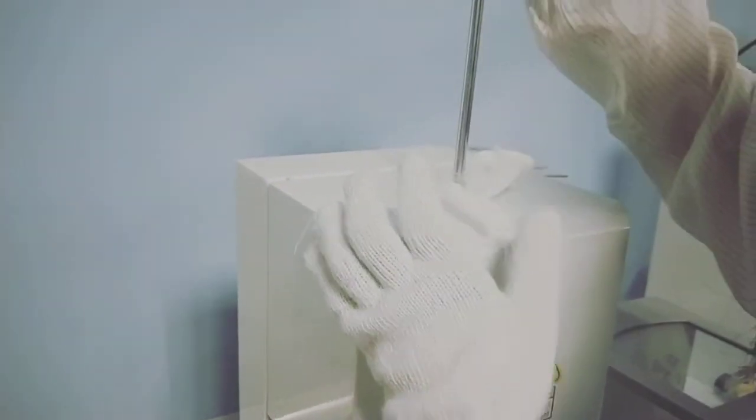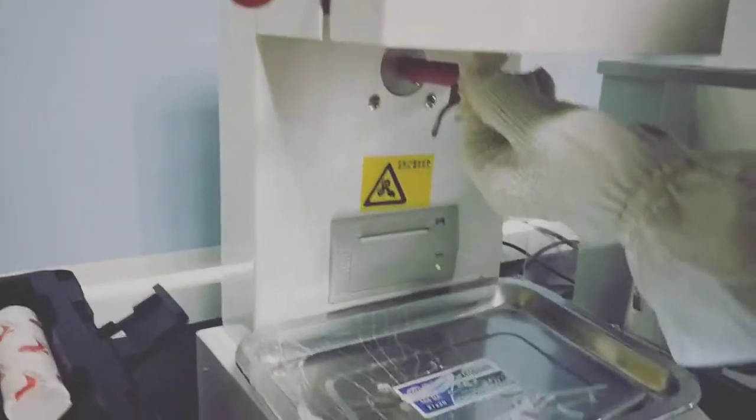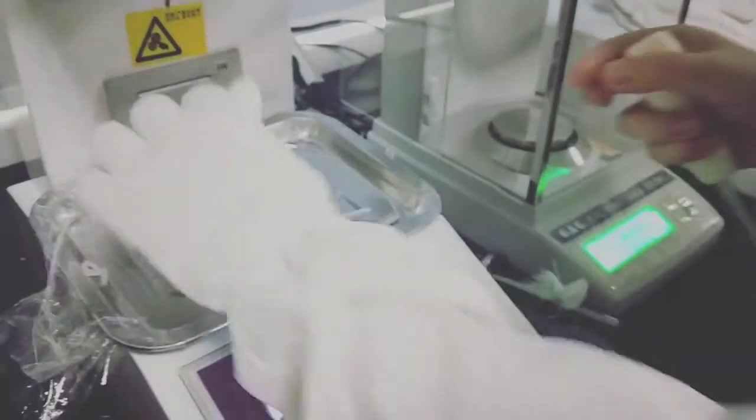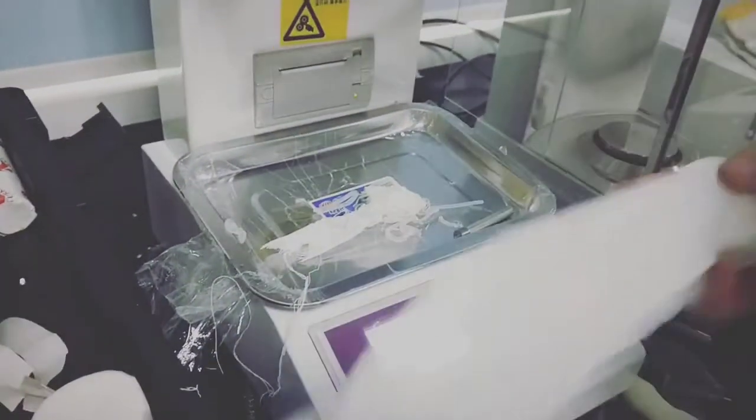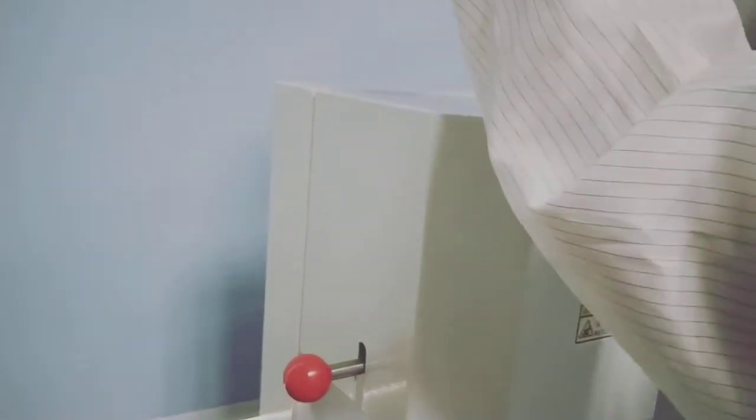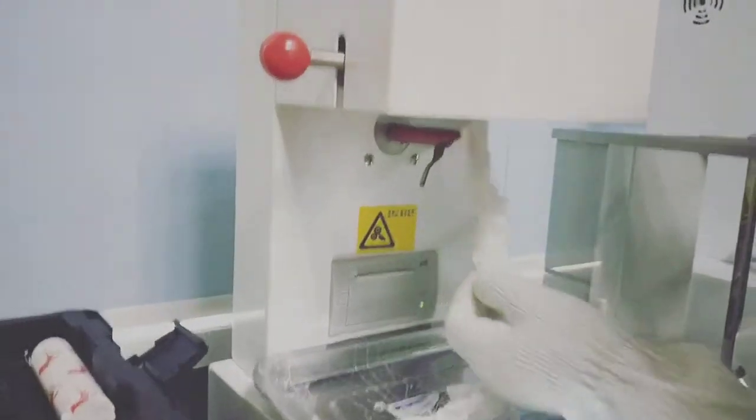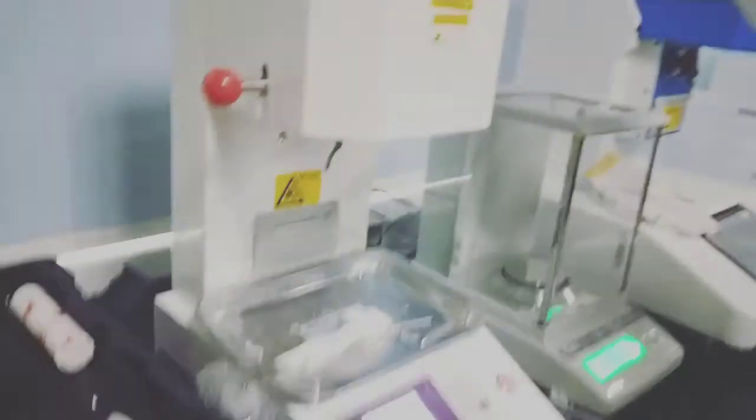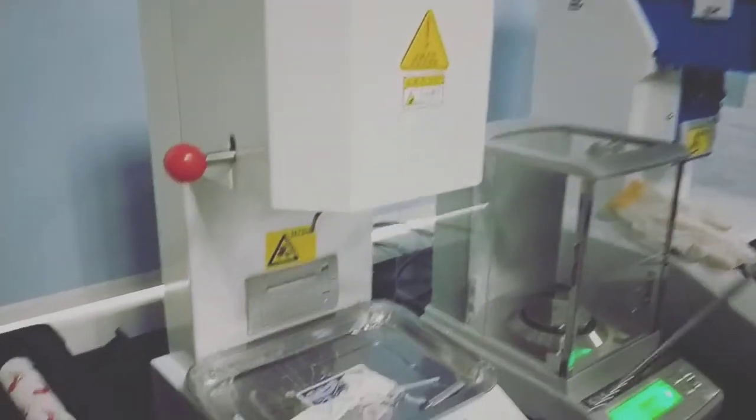Cleaning, clean the sample tank, clean two to three times. On the top, if the inner tank is almost clean, we can stop cleaning and press stop key and off to stop heating. Then finish test. Thank you.